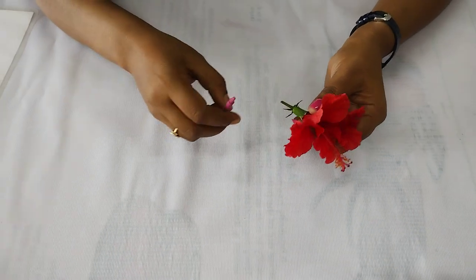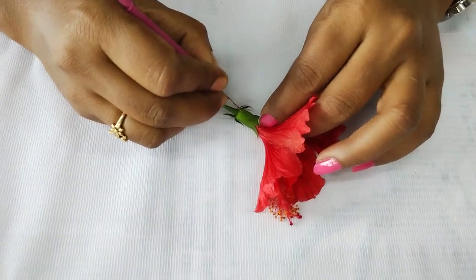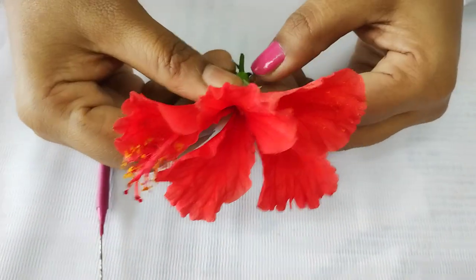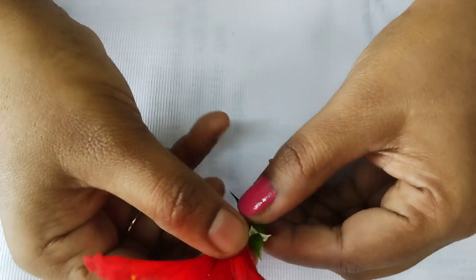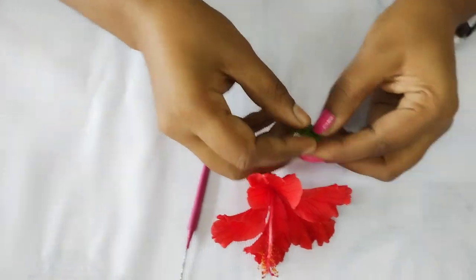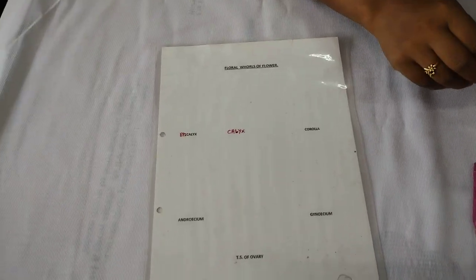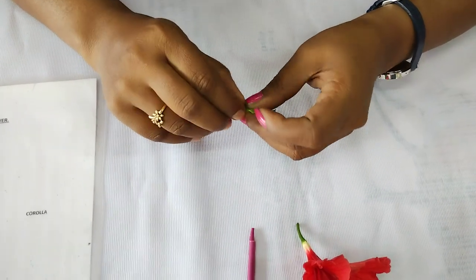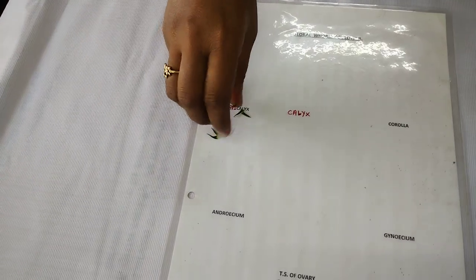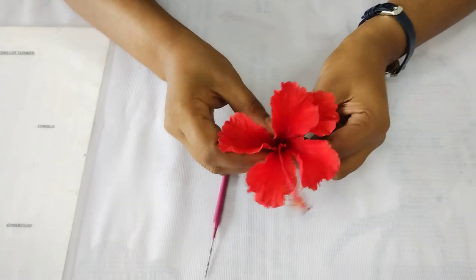Now let's start the dissection of the given flower. First, take the needle. Cut from the baseline and slowly remove the epicalyx and calyx parts. Take one chart and place the epicalyx in the epicalyx section. Next, remove the calyx. The next part is the corolla — remove it slowly.